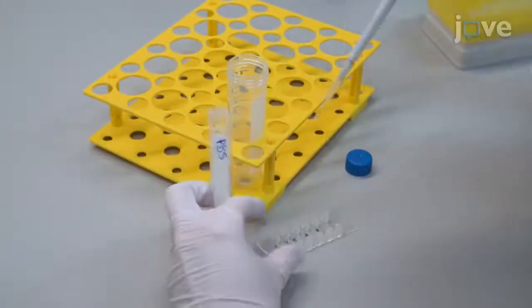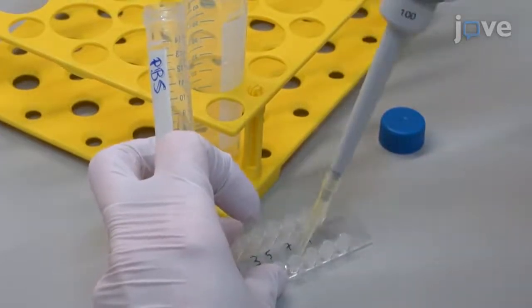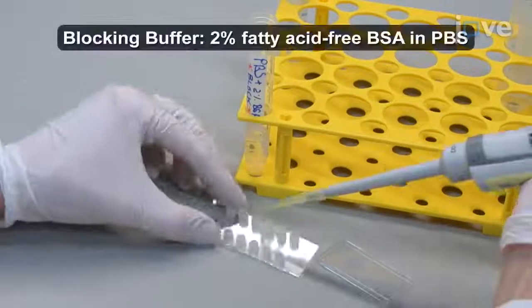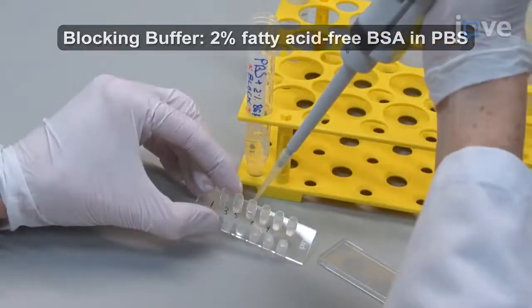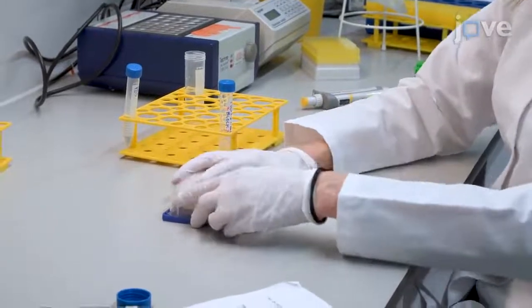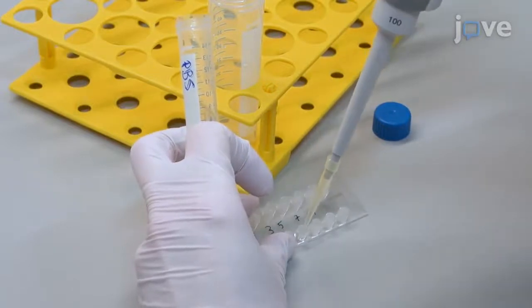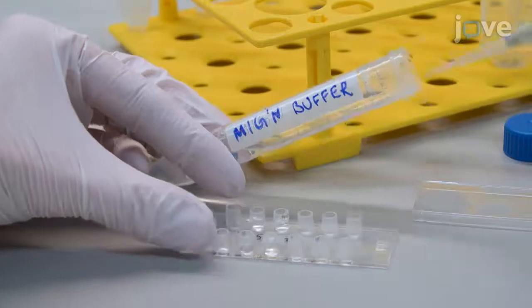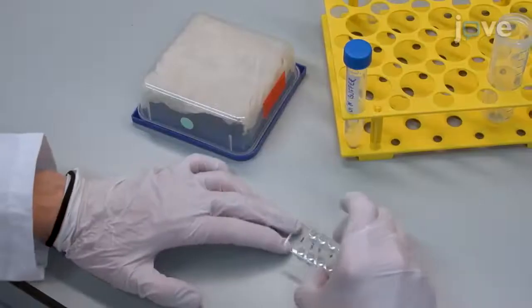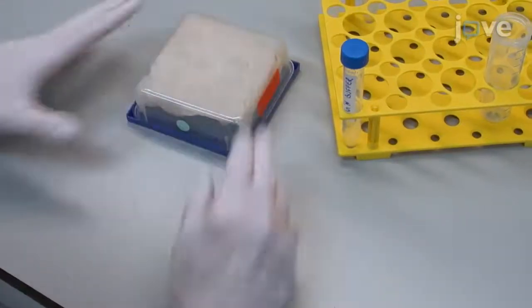The next day, wash the chamber by adding 100 microliters of PBS to one well and then withdrawing 100 microliters from the other well of the chamber. Then, add 100 microliters of blocking buffer to a chamber and incubate the slide in a humid chamber at room temperature for 90 minutes. Next, wash the chamber by adding 100 microliters of PBS to one well, withdrawing it from the other well, and then add 100 microliters of migration buffer to the chamber. The slide is now ready to use. Store it in a humid chamber at room temperature until the experiment.